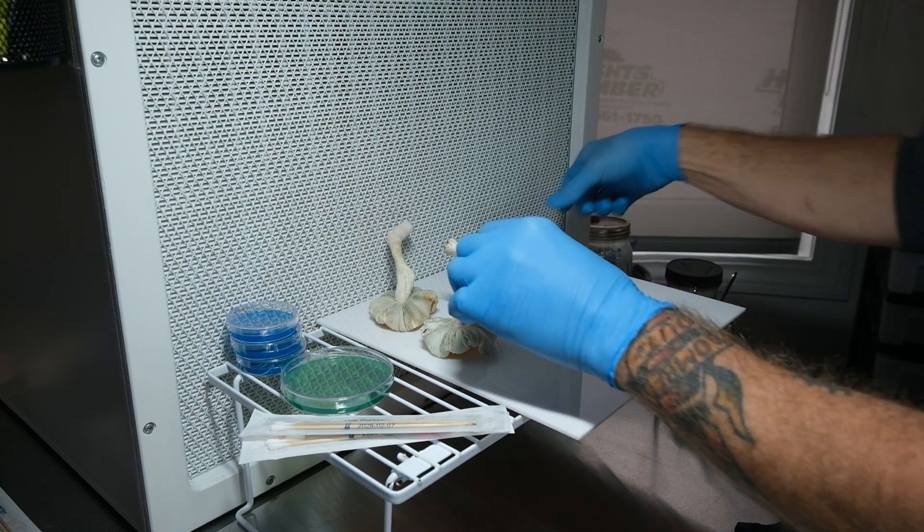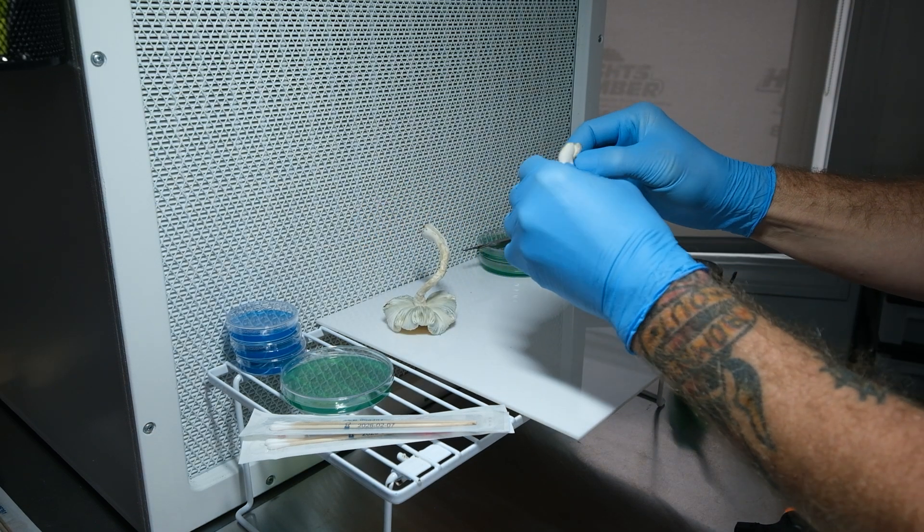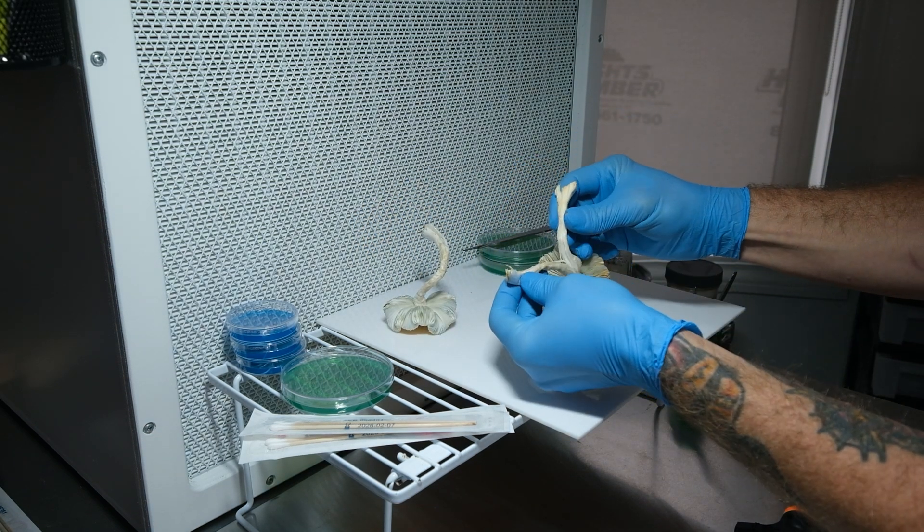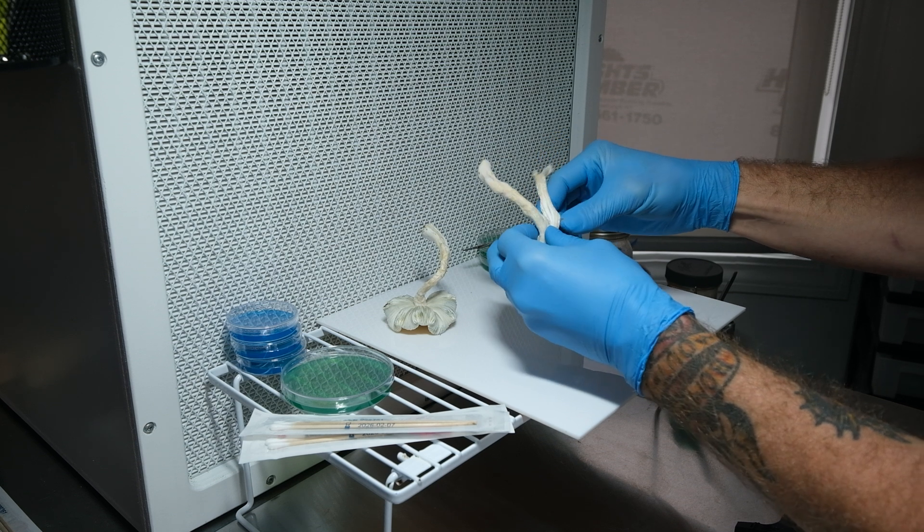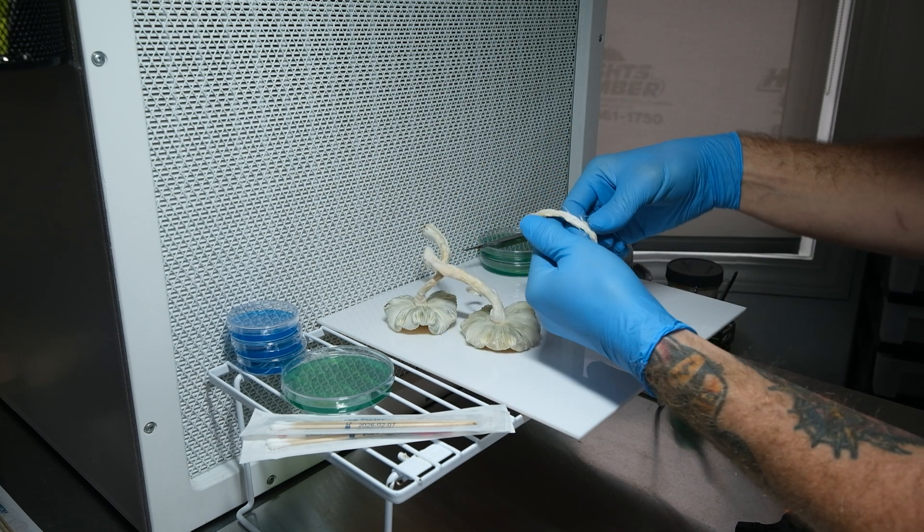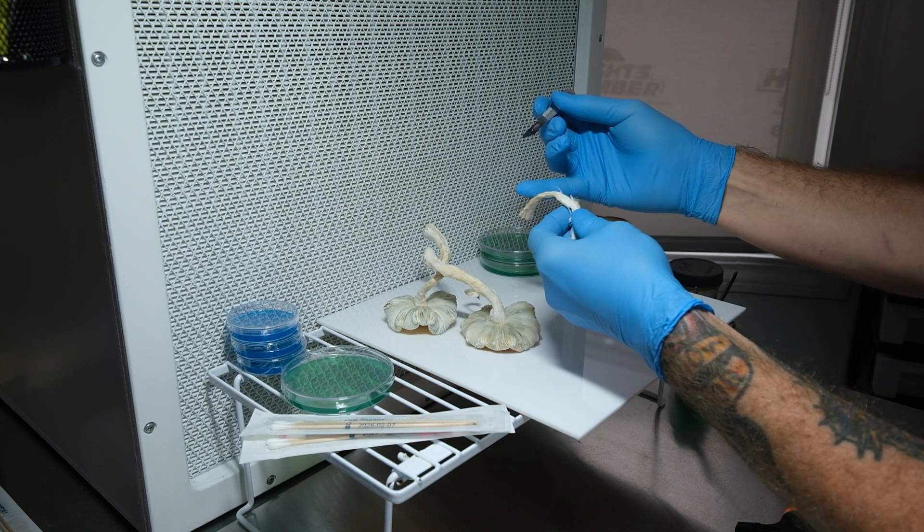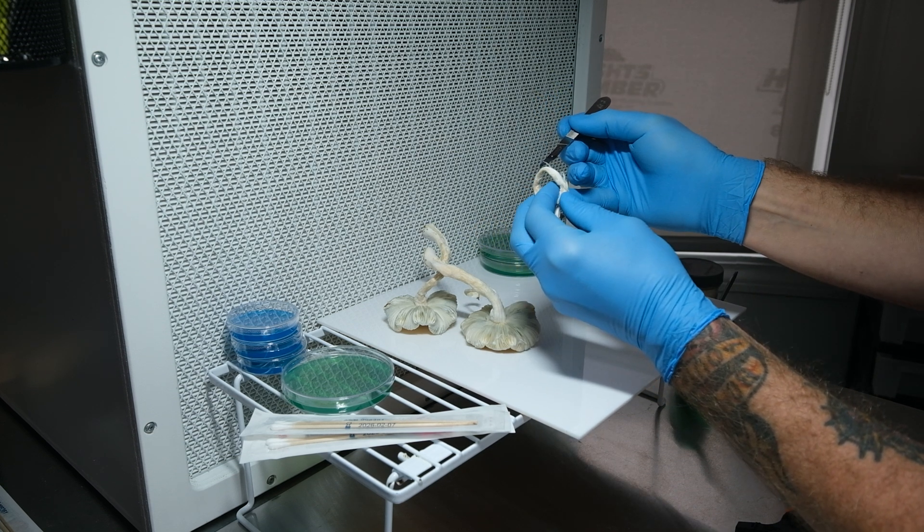We're gonna split the stipe open because this has not been exposed to air and that is as sterile as it's gonna get. So we're just gonna take a tissue sample from inside the stipe here.